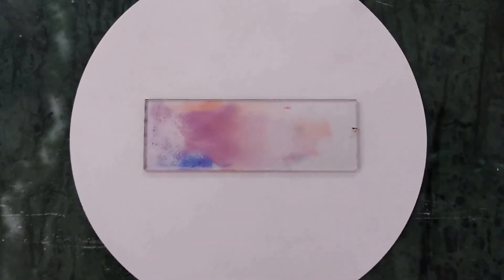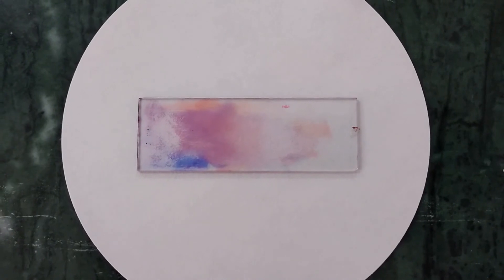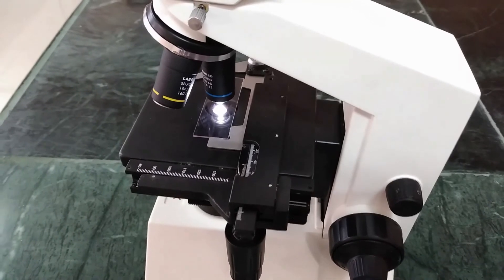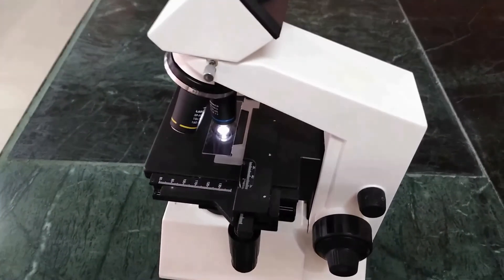Then, the slide is allowed to air dry. After drying, the slide is observed under microscope.